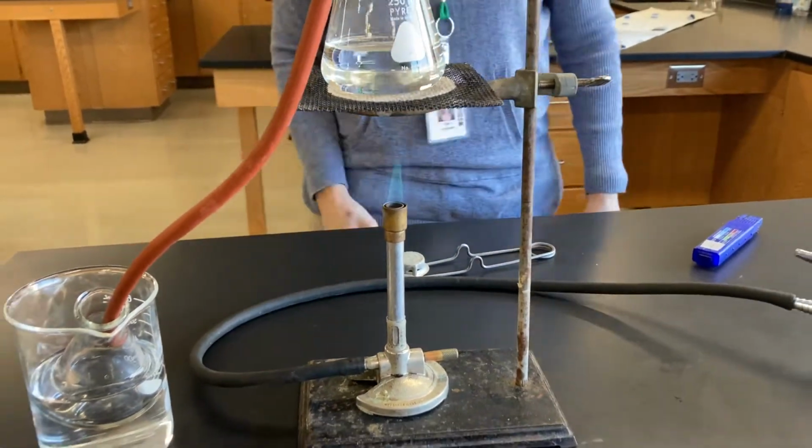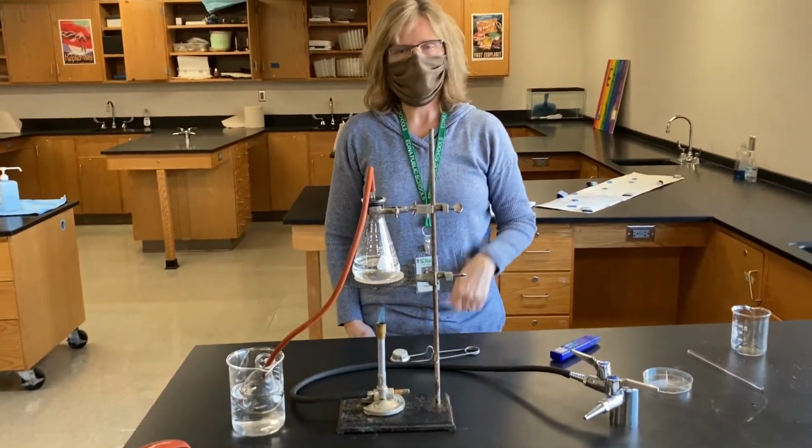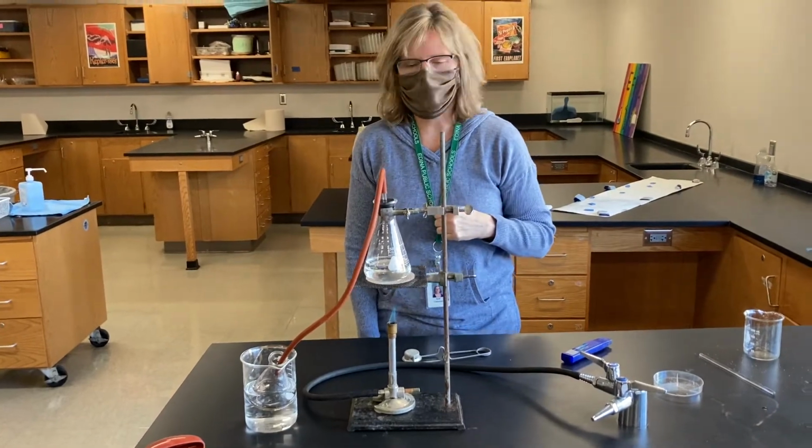Okay. Nice. Now this will take some time, and so we'll show you the video after the water starts boiling. All right, we'll see you guys in a moment.